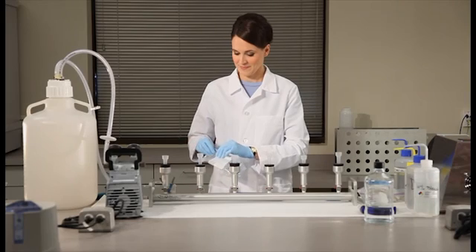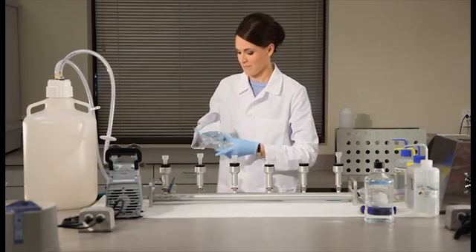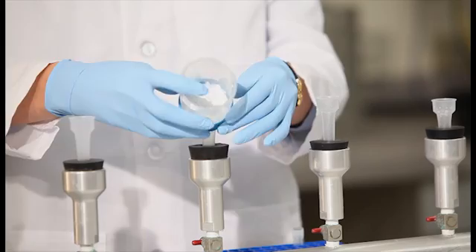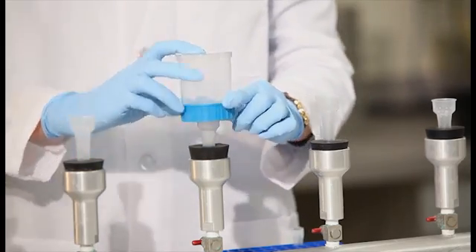The initial step in the qPCR assay for enterococcus is to capture the bacteria in the water sample on a filter. First, attach a disposable filter funnel to the vacuum manifold.